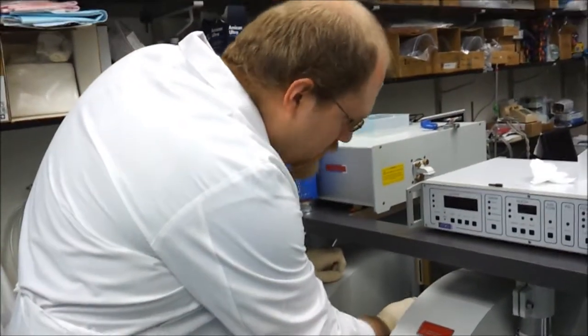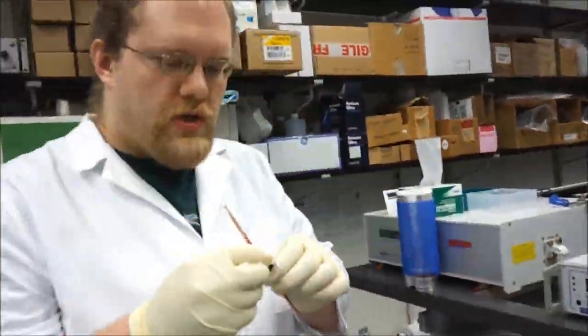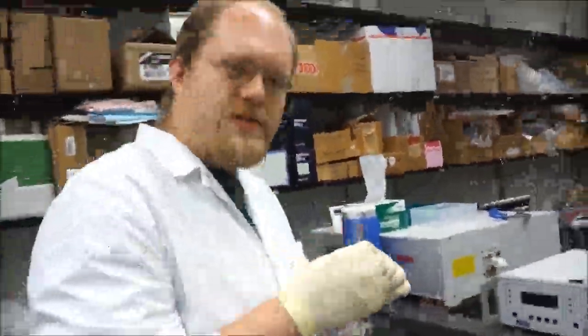So, that is how we freeze an EPR sample. Hope this helps. Thanks.